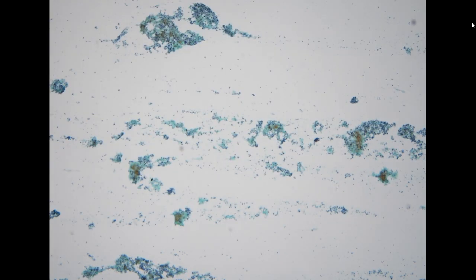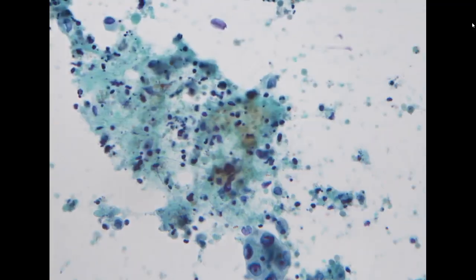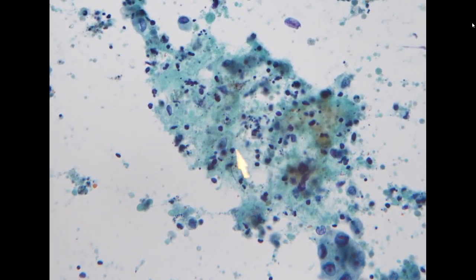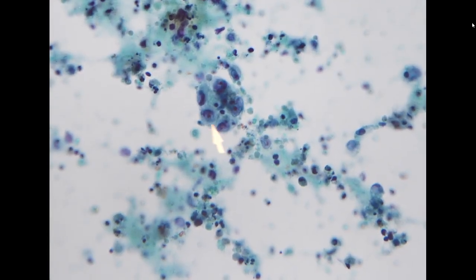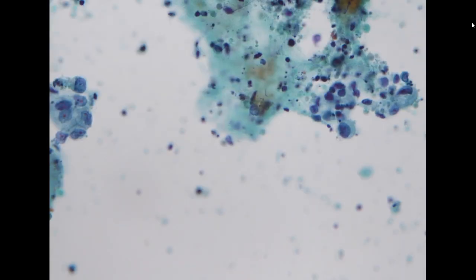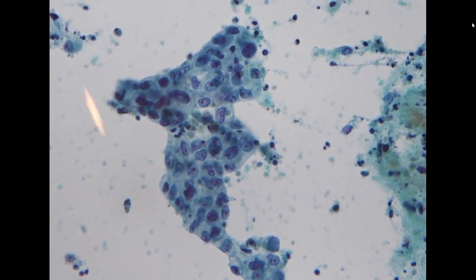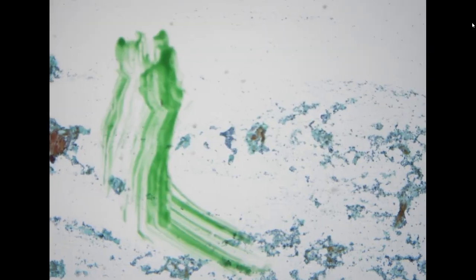Again, another patient with lung adenocarcinoma, and this is the pleural effusion specimen. This specimen is also different from the prior two specimens in that we can see marked necrosis. So this is a highly necrotic specimen, and you can see a lot of karyorrhexis admixed with inflammatory cells. But still, we can appreciate this is a three-dimensional cluster of adenocarcinoma with prominent nucleoli. The cellularity is still appreciable for diagnosis, so this is also adenocarcinoma. This is a highly necrotic specimen, probably due to the prior treatment.